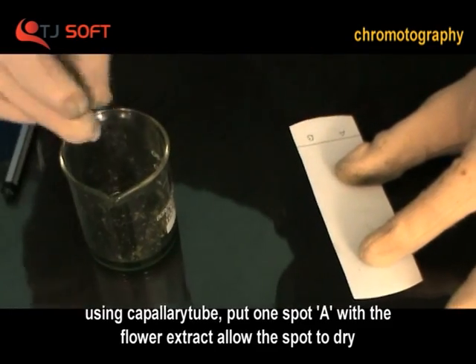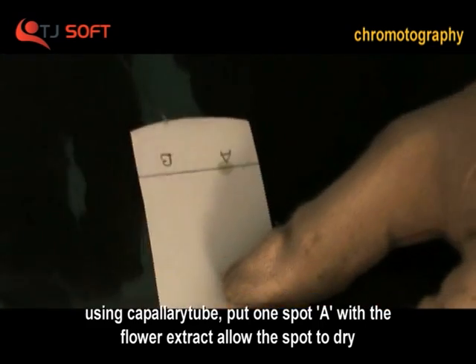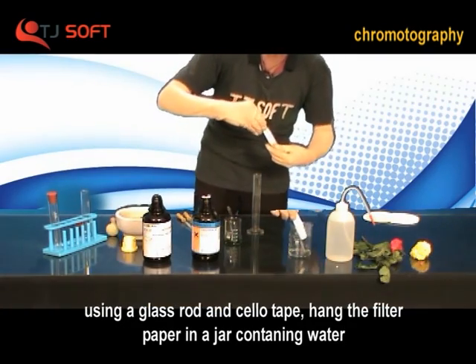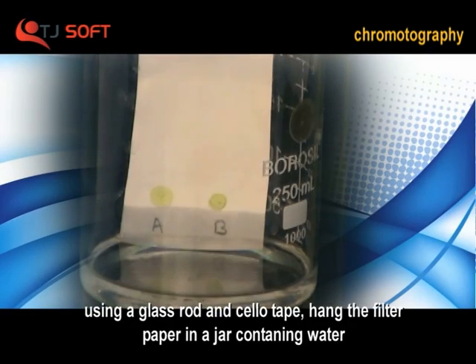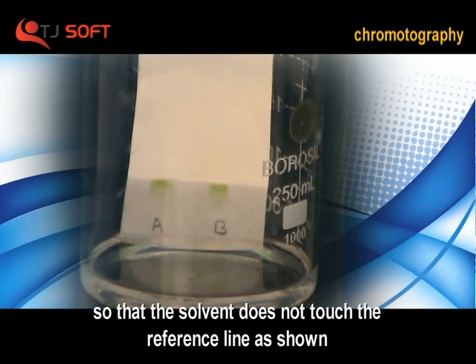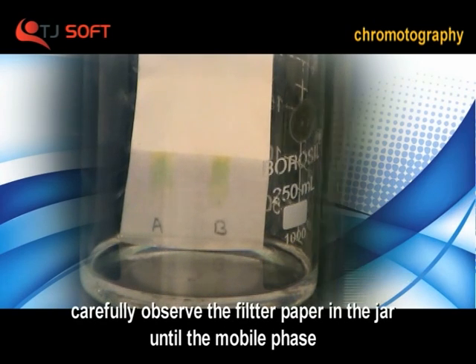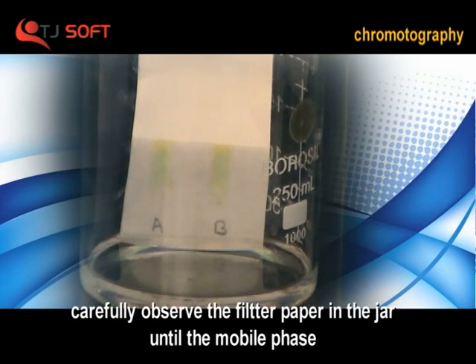Using a capillary tube, put a spot with the flower extract. Allow the spot to dry. Using a glass rod and cello tape, hang the filter paper in a jar containing water so that the solvent does not touch the reference line. Carefully observe the filter paper in the jar until the mobile phase solvent rises up to two-thirds of the length of the paper.